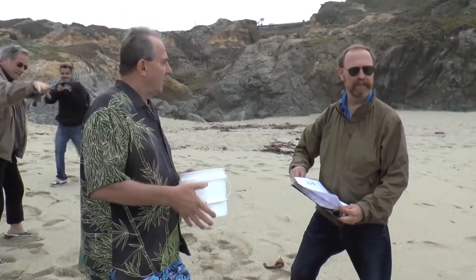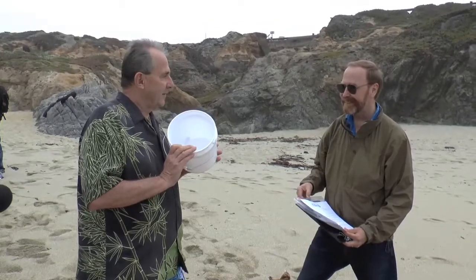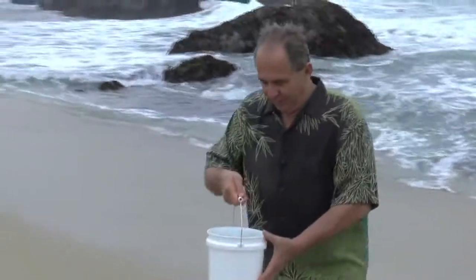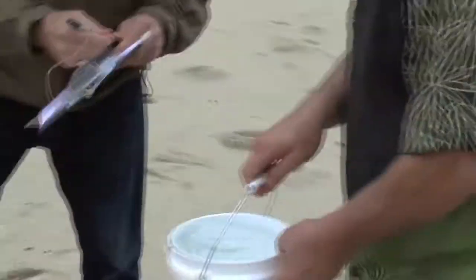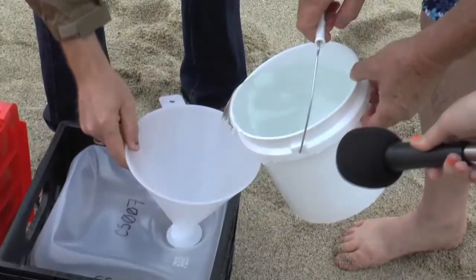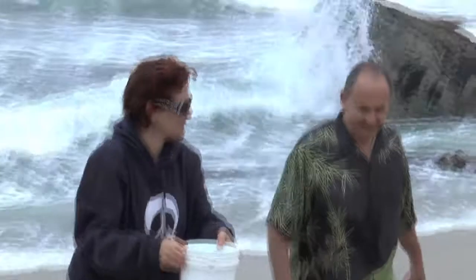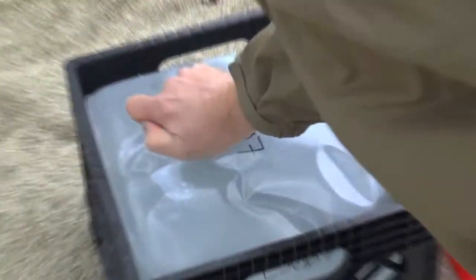The main thing is that we want clear water — we don't want a lot of sand. We will filter out the sand, so a little bit is okay. Don't worry too much. Just don't dump the last little bits out because they'll settle the heavy things. They're filling up. Even though the amount is lower, the cesium will come out. Take a cap, twist it on, hand tight. We're done.